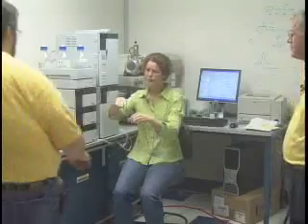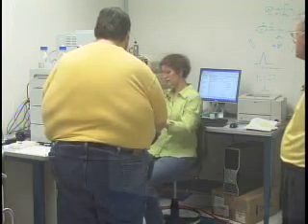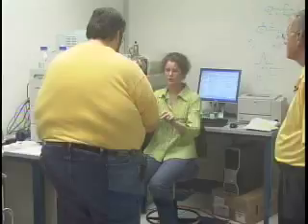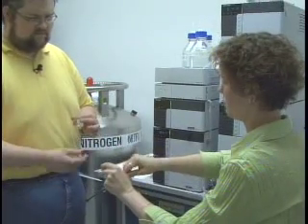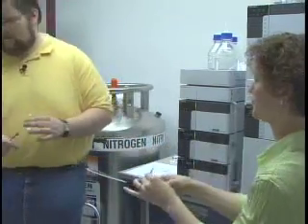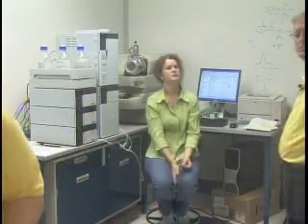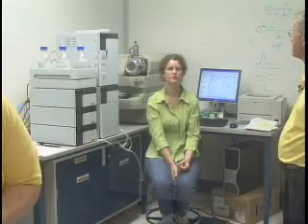Do you have one for me? I do not. Do you have a little needle over there? Oh, I do. Right here it is. Which one do you want? That one or this one? There you go. Please hold. I'm just going to make a real rough dilution. I'm going to squirt out about 3/4 of this.